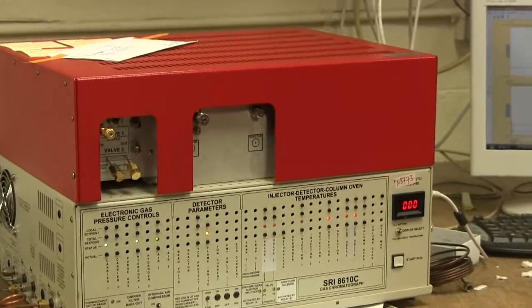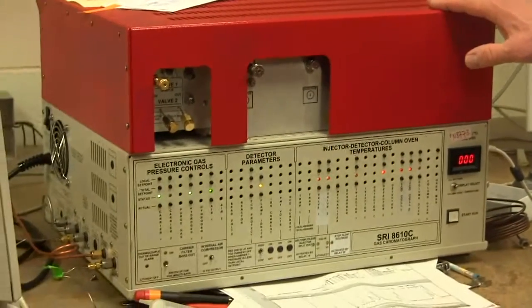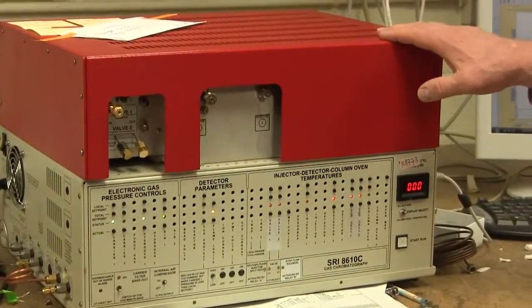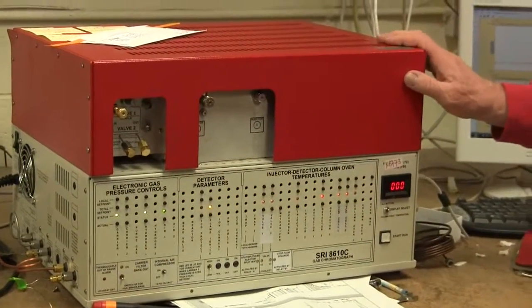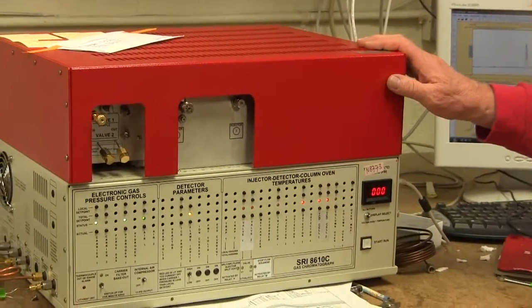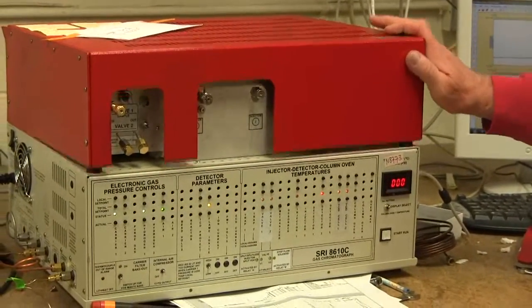Hi, my name is Hugh, and this is an SRI 8610 GC, and I'm going to show you today how to know if your flame is lit. That's the flame of the flame ionization detector that we're talking about, FID detector.